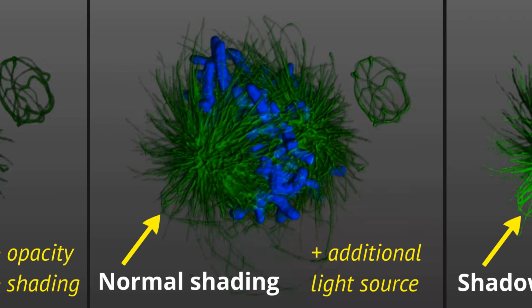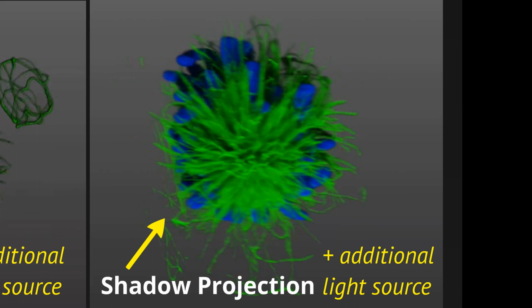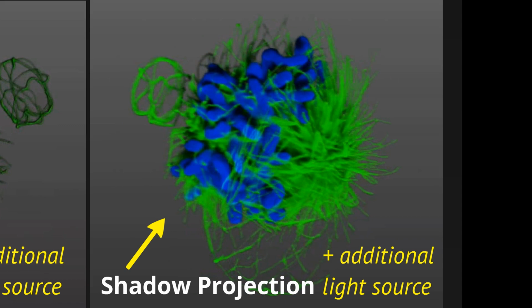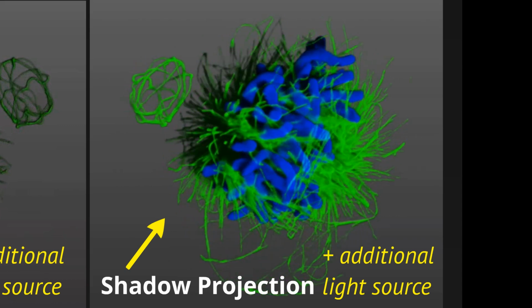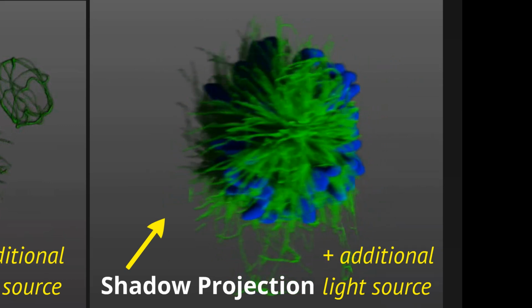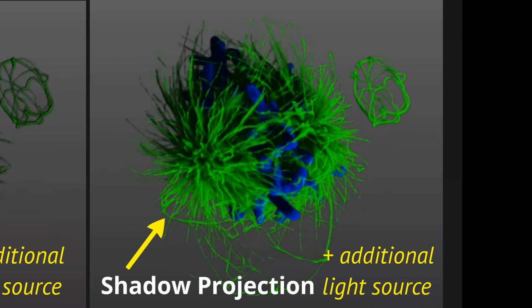Okay, we now come to my favorite, also the most computationally intense, rendering technique. It's called a shadow projection. Internally, we call it the money shot. The reason is that when people use this, they're typically using it to give you the most three-dimensional looking structure possible. We're trying to convey 3D as best we can. And this is usually the rendering technique, if someone is lucky to get a journal cover, that you want to go with.